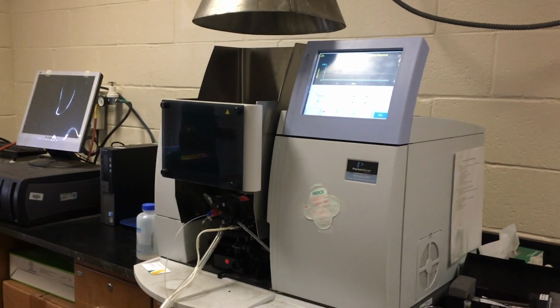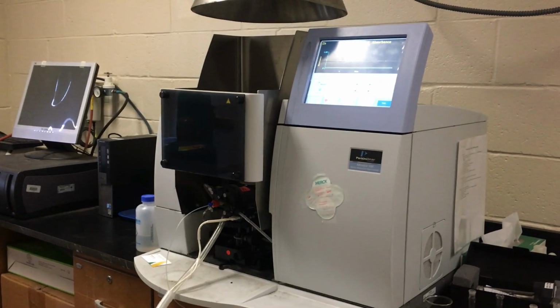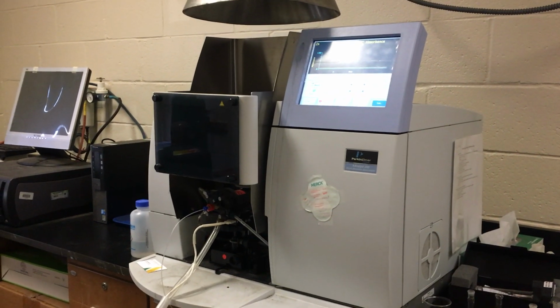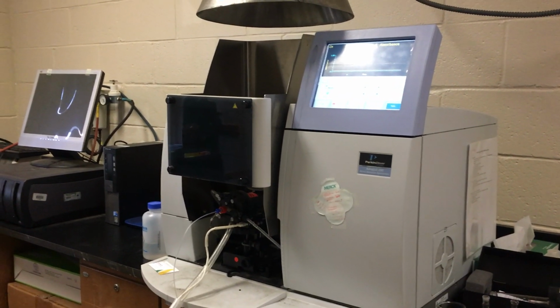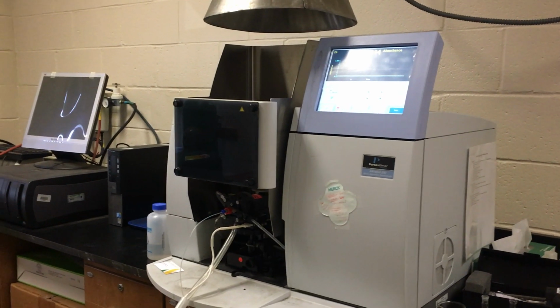Hi, this is Melissa Langston, Associate Professor of Chemistry at Delaware Valley University. I'll be explaining atomic absorption spectrophotometry today and including a demonstration to determine the concentration of zinc in unknown solutions.